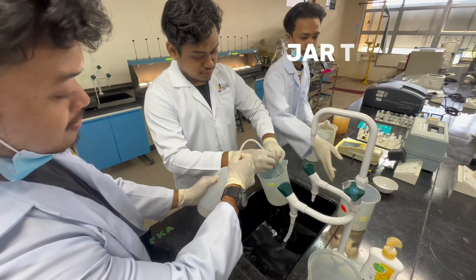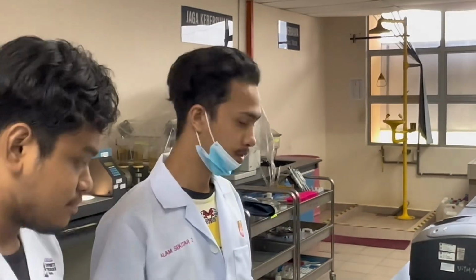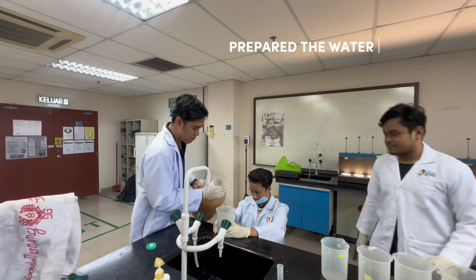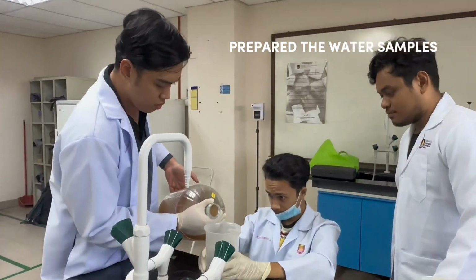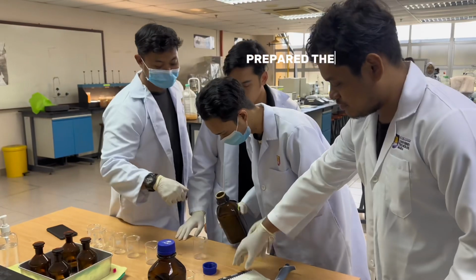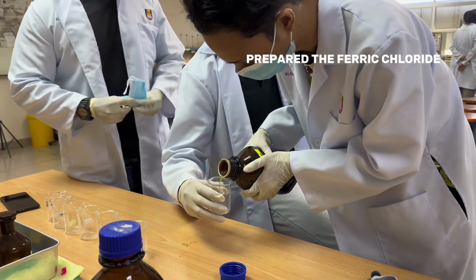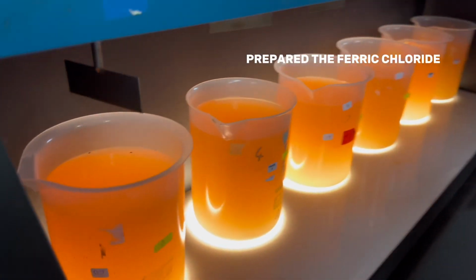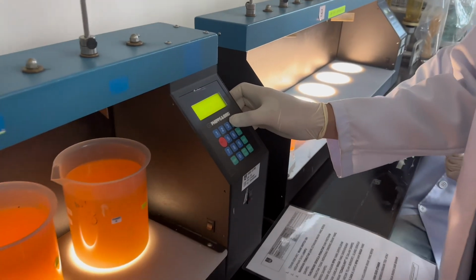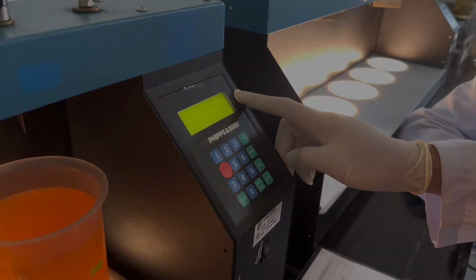For jar test procedure, first, 6 beakers of 1 liter capacity are prepared and washed using distilled water. Second, 1 liter of the raw water sample is poured into each of the 6 beakers. Third, each of the 6 beakers represents a different concentration of ferric chloride, which are 0, 2, 4, 6, 8, and 10 ml of ferric chloride, and each beaker is labeled with its corresponding concentration.